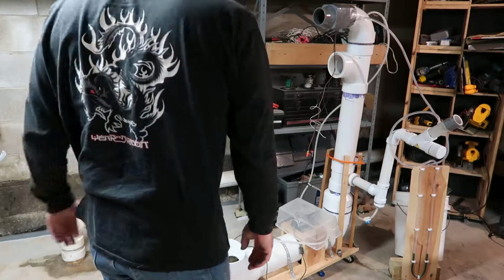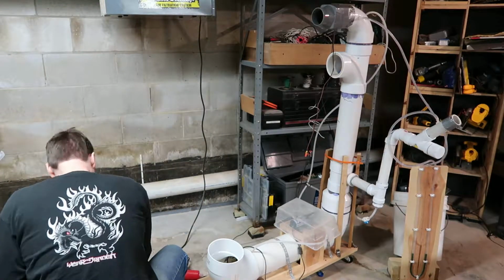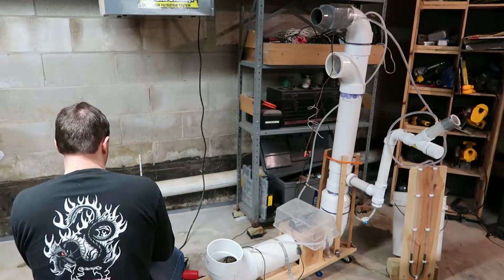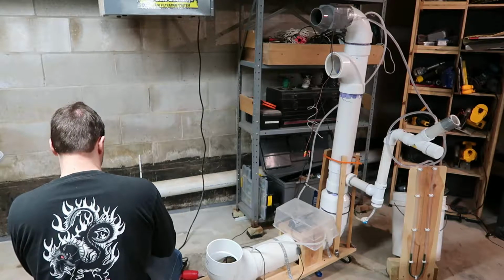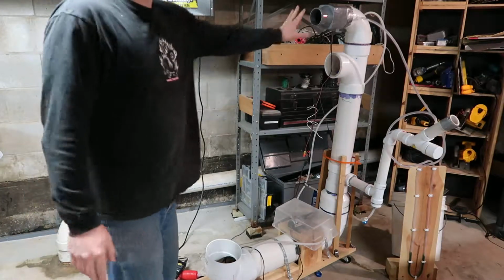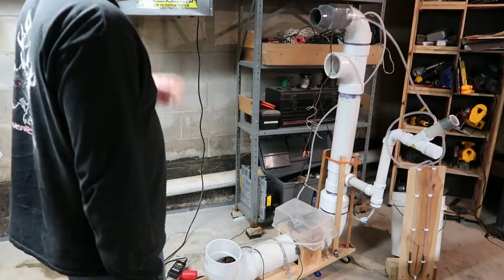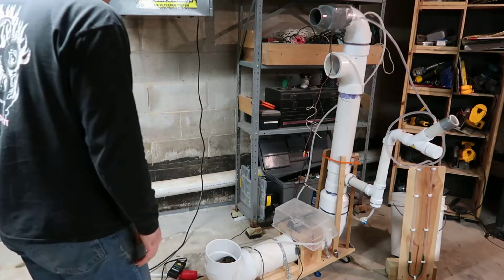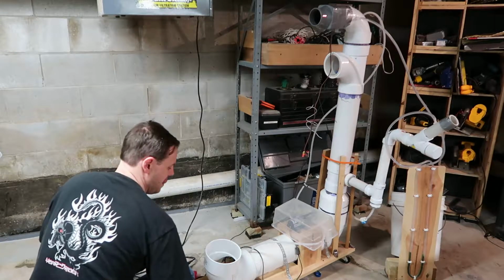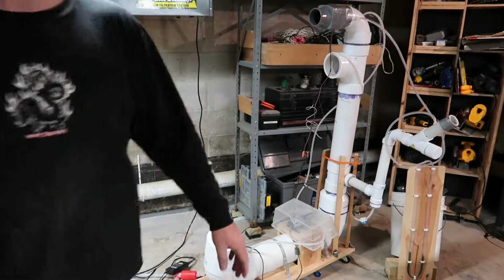So I'm going to plug in the inline blower fan first, so that gets all the material, the vapor phase, actually moving. It's not a big deal what goes over it. It's kind of loud, just blowing away there. And once that is going, then the pump can be plugged in. So, the pump, plug that in. Again, make sure that the cap is on down here. And then it's off to the races.